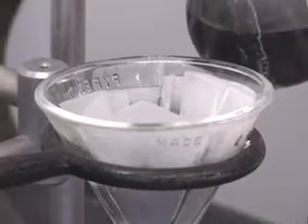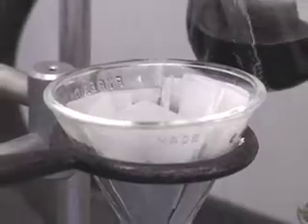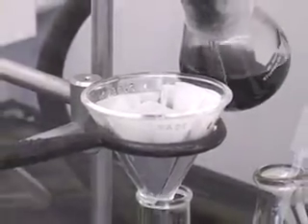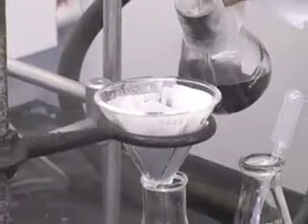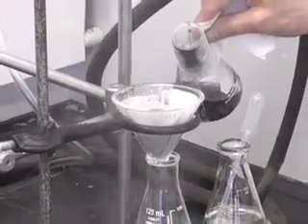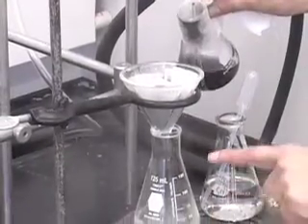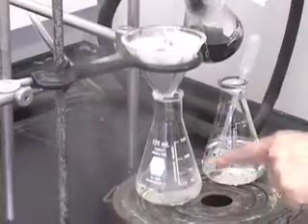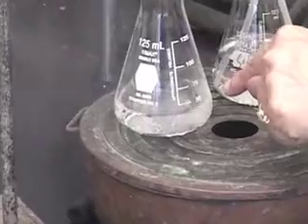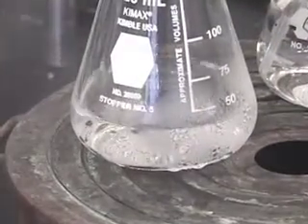When you are doing this filtration, if you notice that the filtrate has any other color apart from looking like solvent, if you notice, there is no difference between my solvent chamber here and the filtrate. It's not gray, it's not yellow, and we know that triphenylmethane is white, so it should look the way it looks. If it is gray, that means some of the charcoal has overflown onto the filtrate. Then we have to do the filtration again. So be careful when you're filtering.